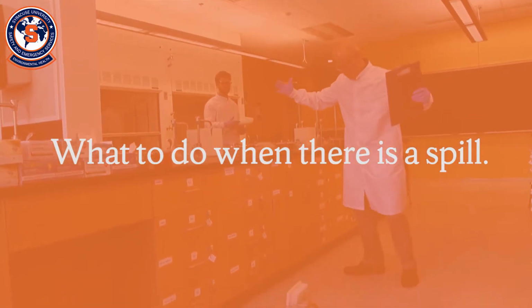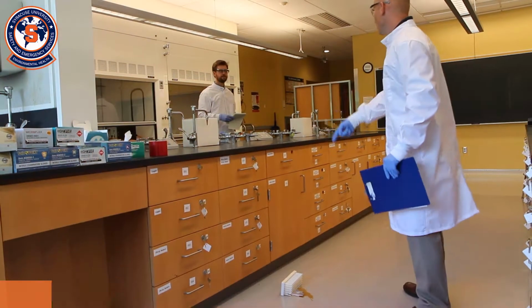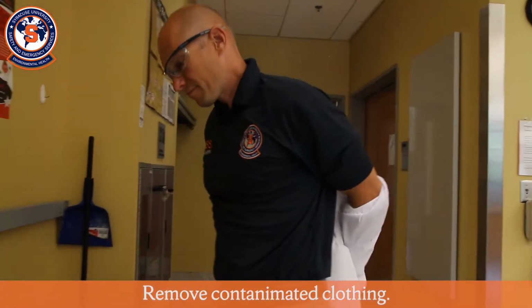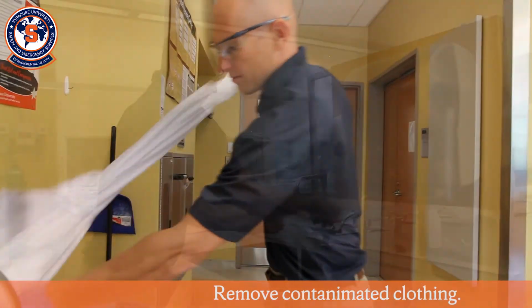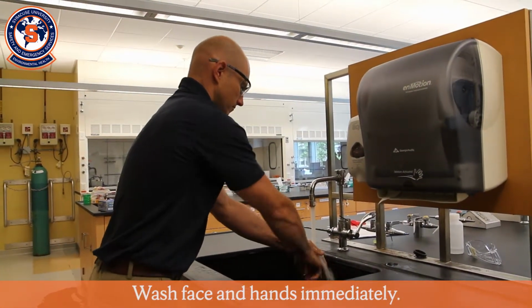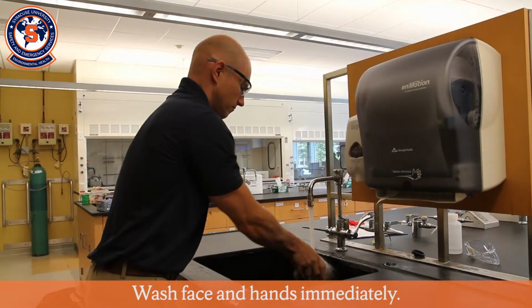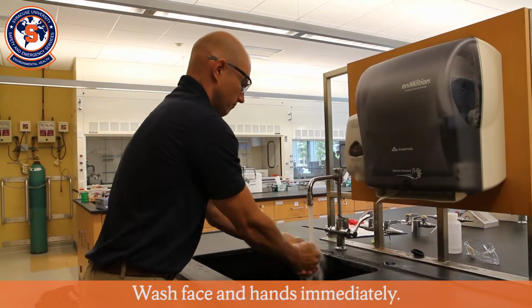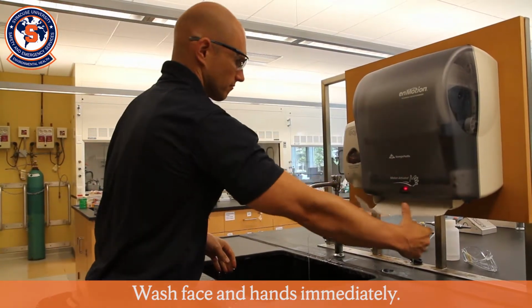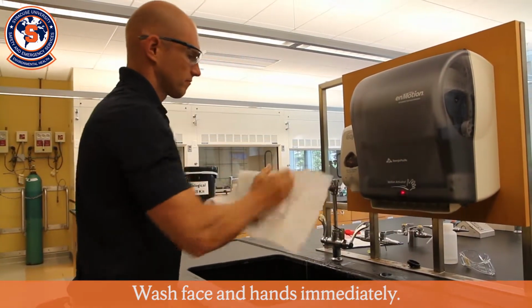If you are splashed with infectious material during the spill, notify others in the area of the need to evacuate. Remove all contaminated clothing, and thoroughly wash your face, hands, and any exposed body area. If necessary, use an emergency shower in the immediate area. Contaminated clothing should be decontaminated or disposed of as biohazardous waste.